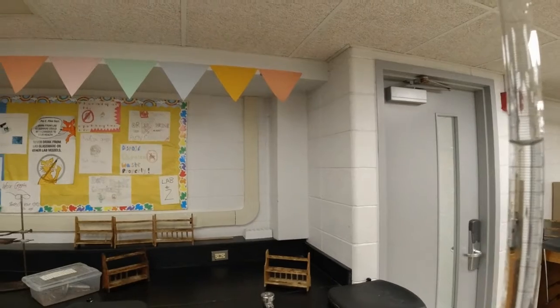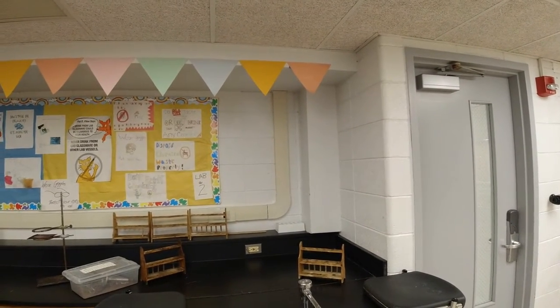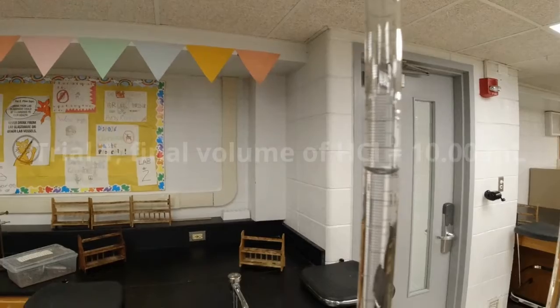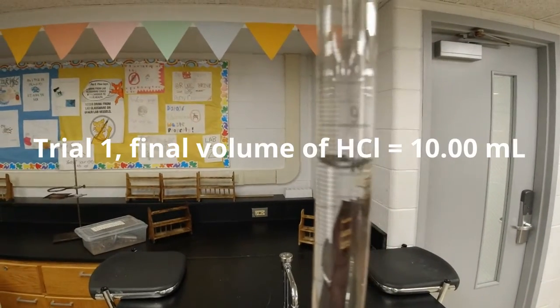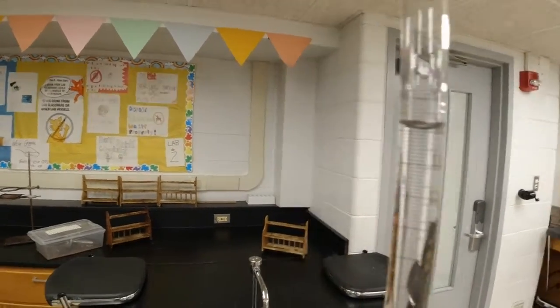I'm going to try to get this exactly on 10. If it's not exact, it's okay. Our calculation will take care of that. And there, I got it. If I look at that carefully, that should be right on 10 milliliters, the bottom meniscus of 10 milliliters.